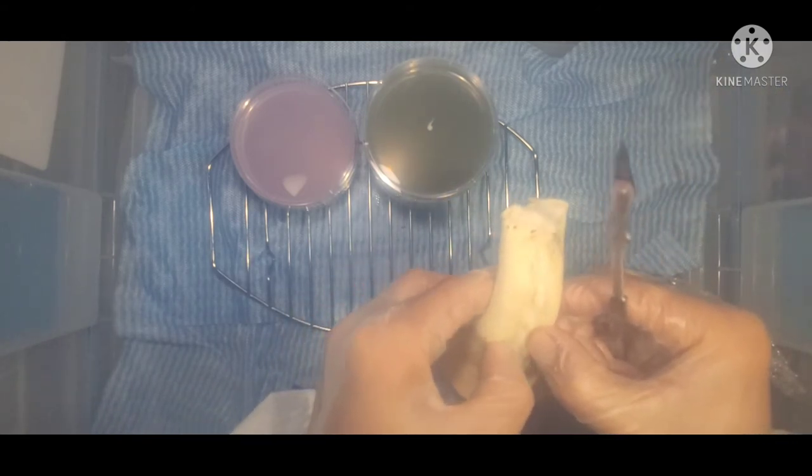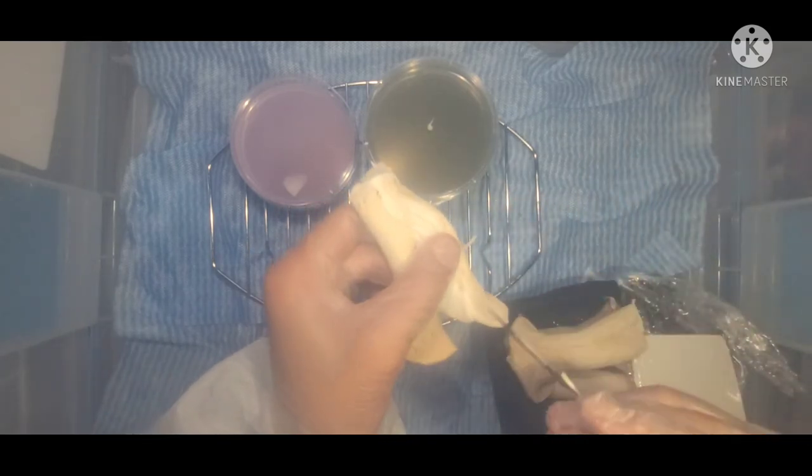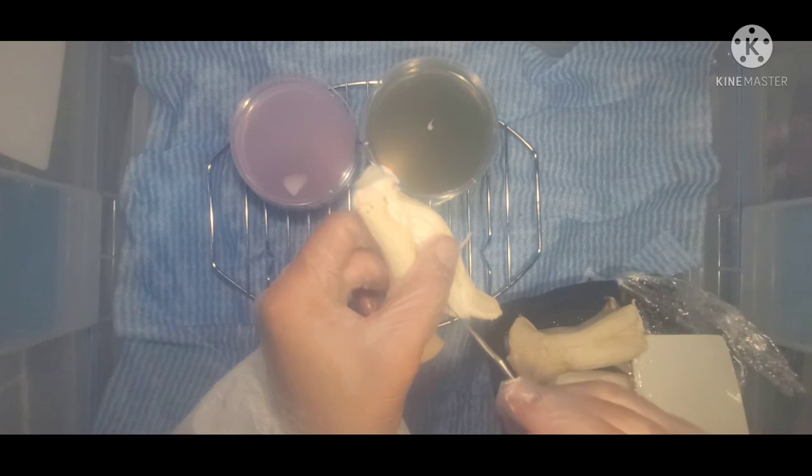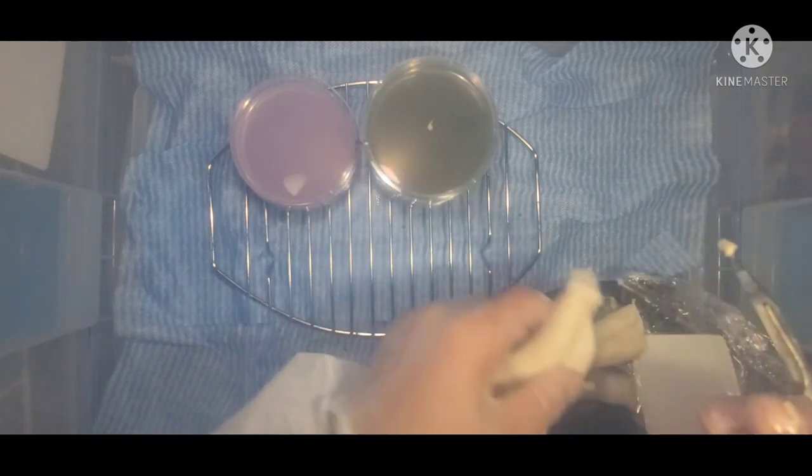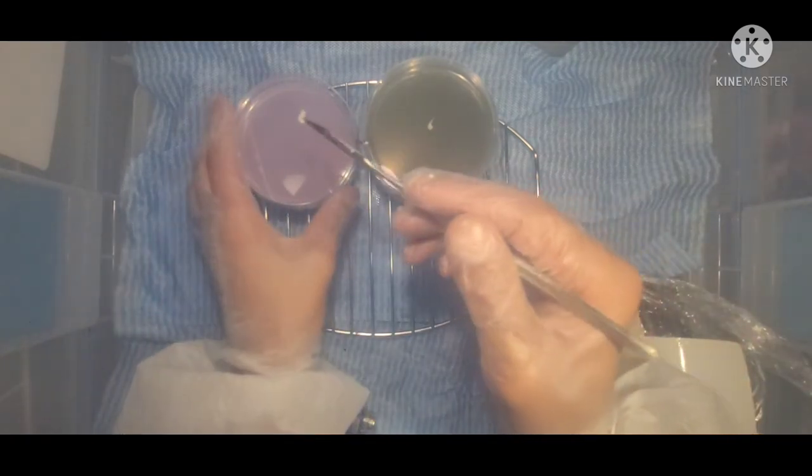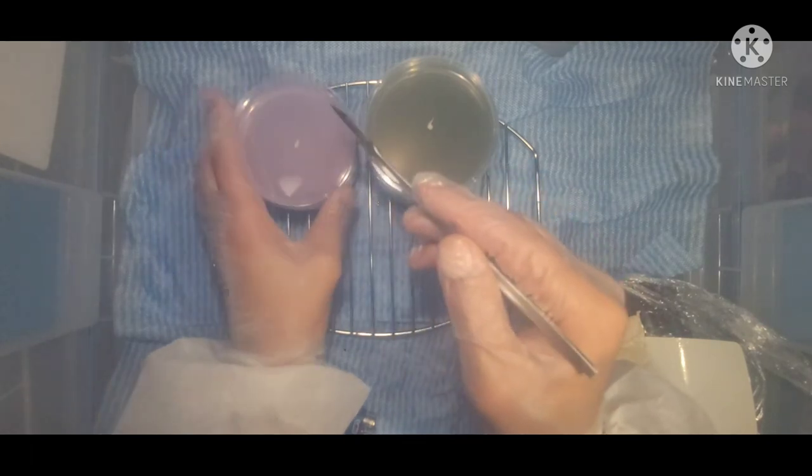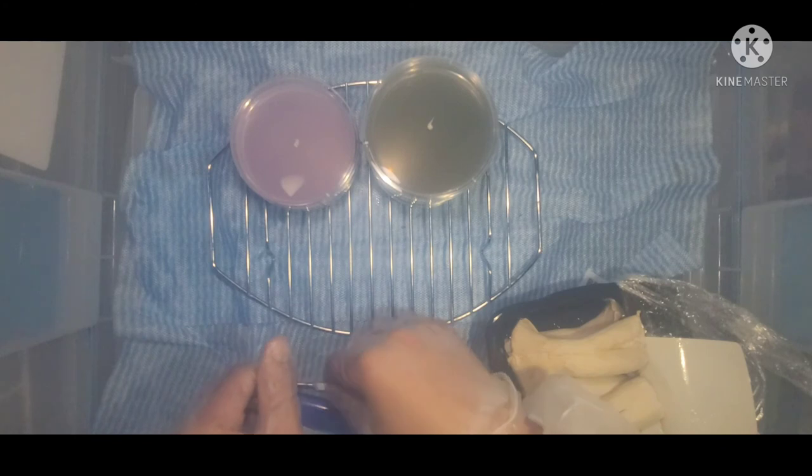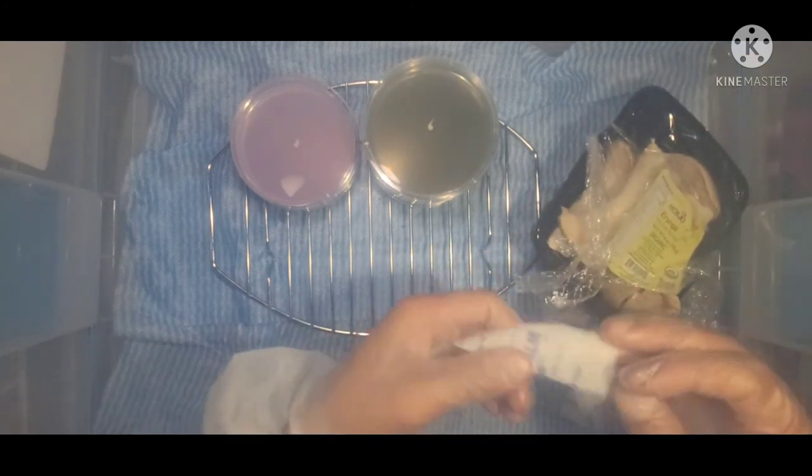This one I'm gonna take more towards the cap. Now if you can bust inside the mushroom here, you can get a sample that hasn't been exposed to the air, so the chances of it being sterile are higher. So we'll just take that right there and that's it. Got my parafilm here.